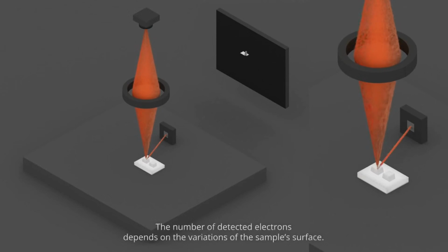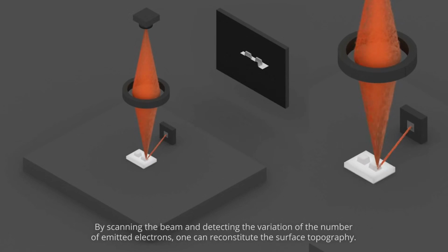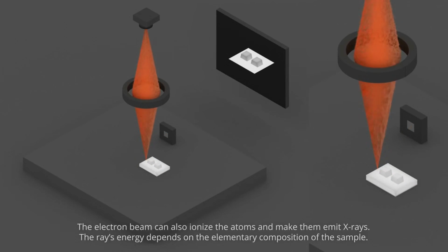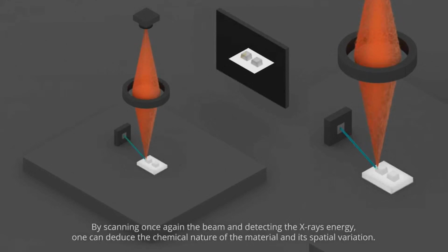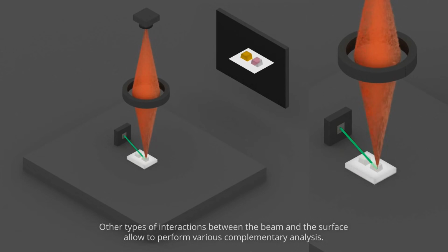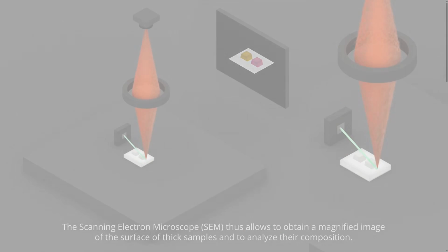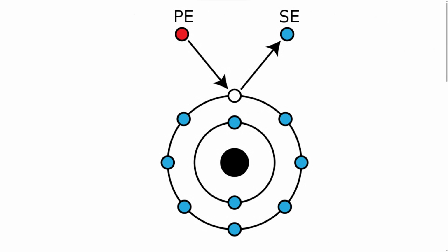Usually we use scanning electron microscopy to map the surface topography of a sample. The electron beam is scanned in a raster scan pattern, and the position of the beam is combined with the intensity of the detected signal to produce an image. Usually we use the secondary electrons emitted by the atoms excited by the electron beam, which are detected by a secondary electron detector. Based on their number, we'll have a different signal and color on the image. Therefore, we can zoom into a resolution better than 1 nanometer.